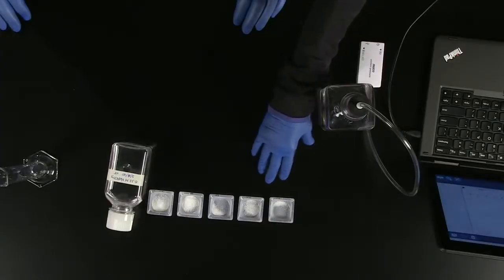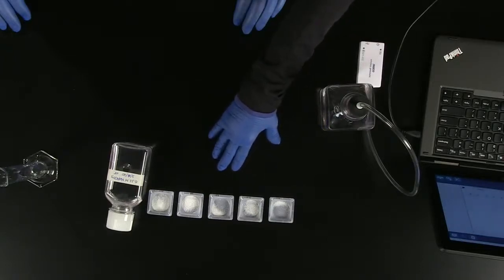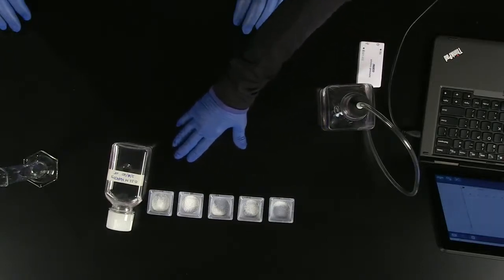We have 0.1 gram, 0.2 gram, 0.3, 0.4, and 0.5.